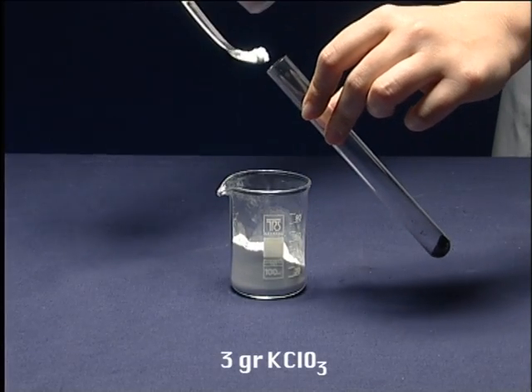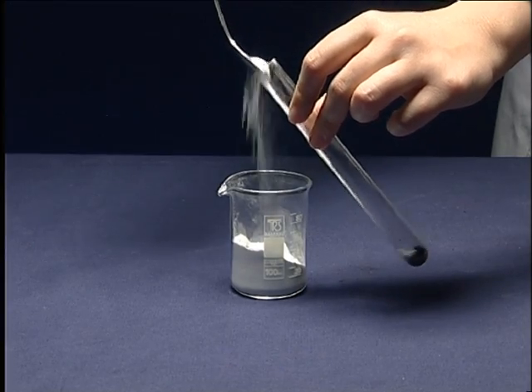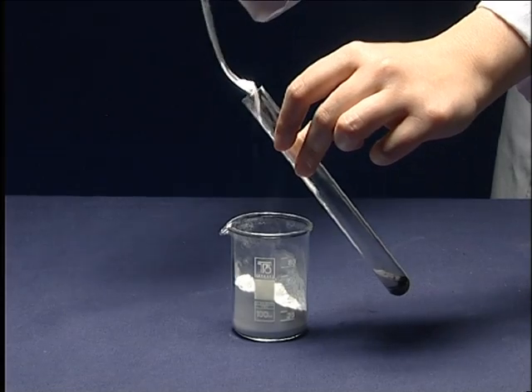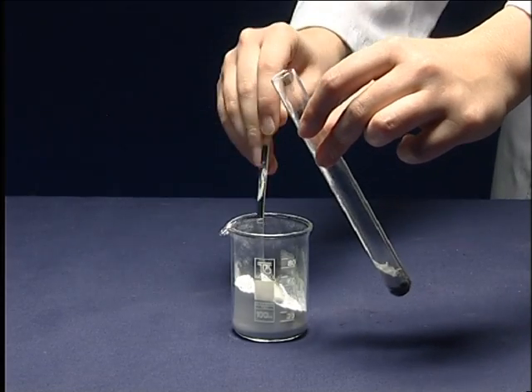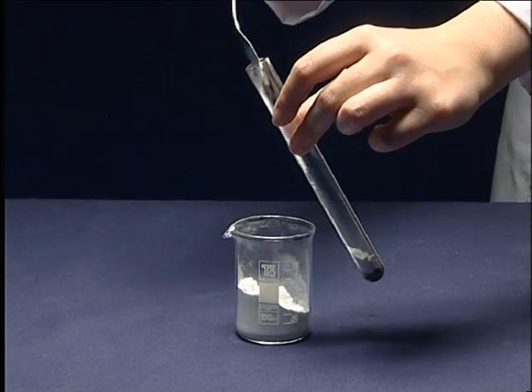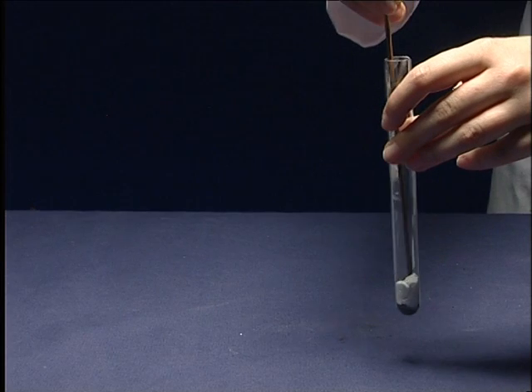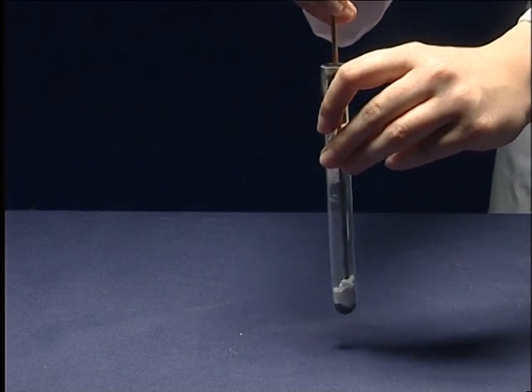Add 3 grams of Potassium Chlorate to the test tube. Stir the mixture thoroughly.